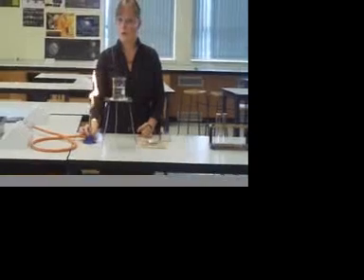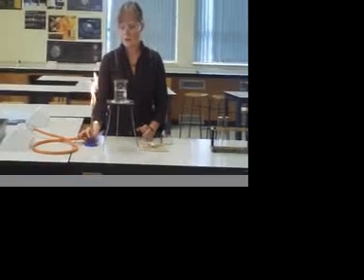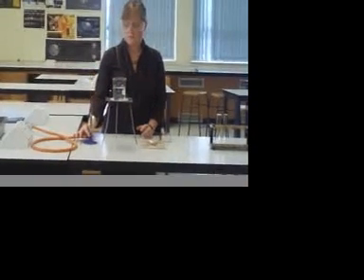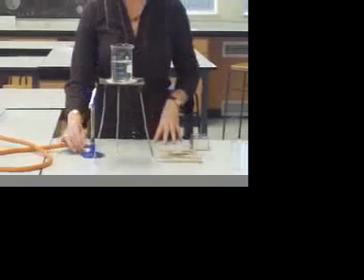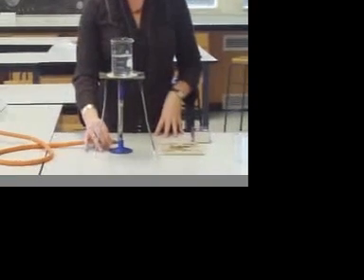But to heat anything you need a blue flame, a hot blue flame, not the safety flame. Turn the valve to get a blue flame, then move the Bunsen underneath the beaker, not the other way around.